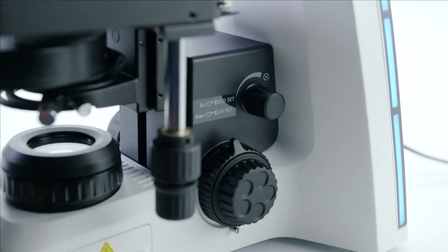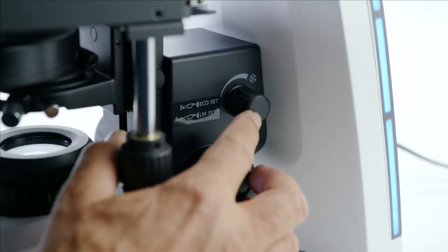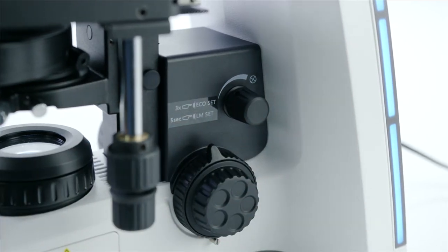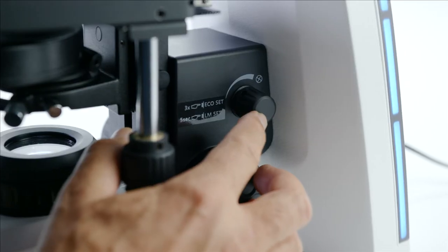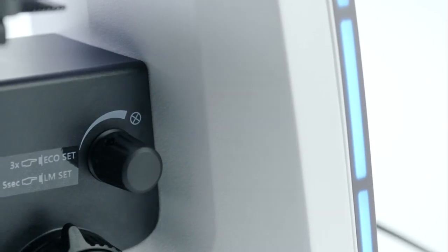All you have to do to activate the Eco Mode is triple-click on the Light Intensity knob. The lowest layer of the LED on both sides of the microscope stand will start to breathe. That is, to blink slowly.